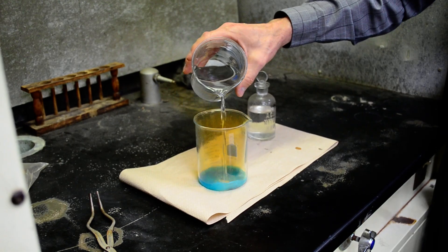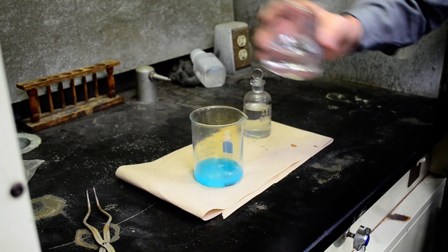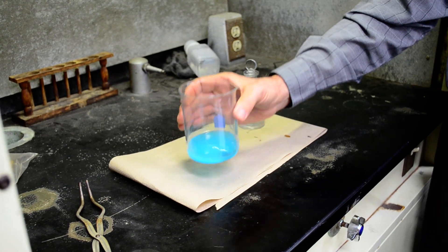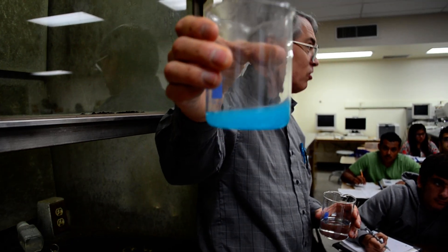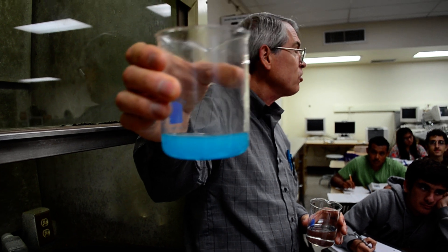Now I'm going to stop it, or slow it down anyway. Whoa, look at that. Where is that blue color coming from? What is it? What do you think it is? It's the copper ion.